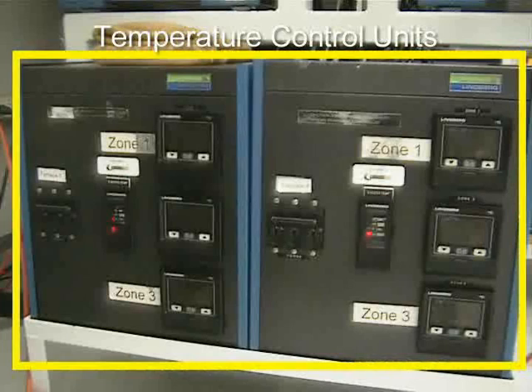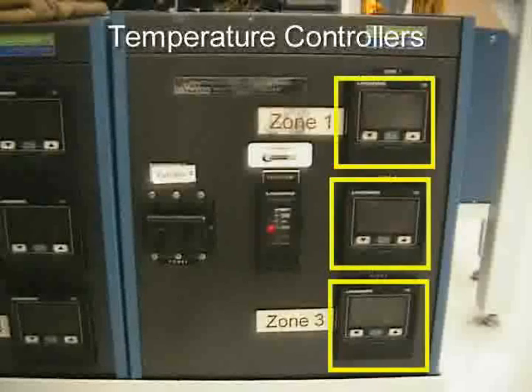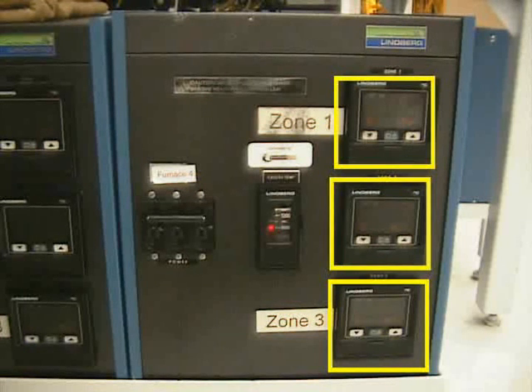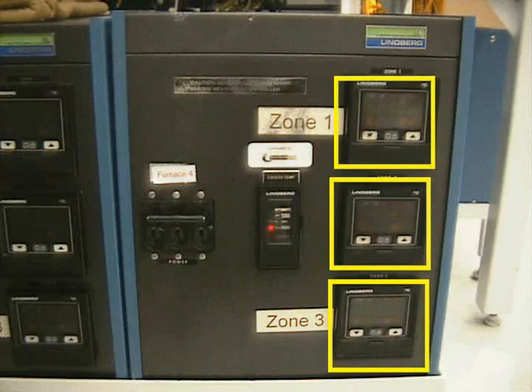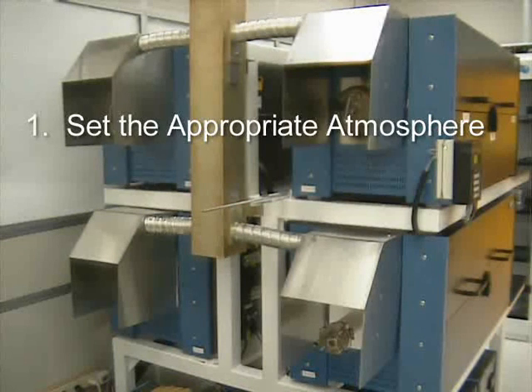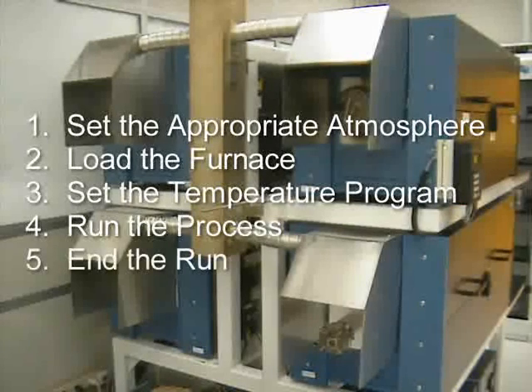The furnace temperature is controlled by a programmable temperature control unit. There is one control unit for every furnace, and there are three programmable temperature controllers on each unit. These controllers control each of the furnace oven heaters and allow the programming of several process steps. To operate the furnaces, you must be able to perform the following steps: set the appropriate atmosphere, load the furnace, set the temperature program, run the process, and end the run.